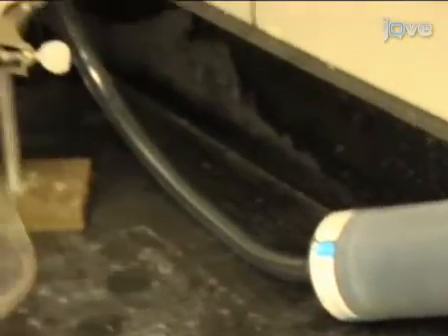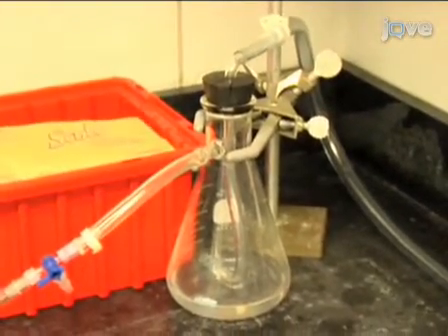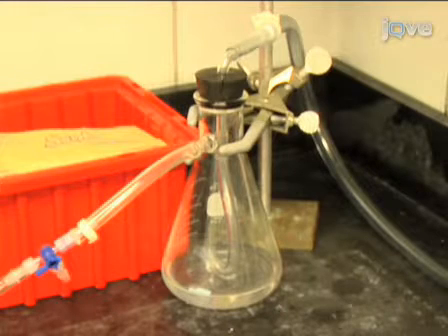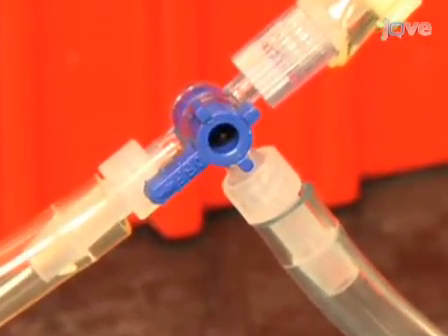Rubber tubing connects the air source to a carbon filter for air filtration. Rubber tubing also connects the other side of the carbon filter to an Erlenmeyer flask via a hollow rubber stopper. The flask should be filled with about a ½ inch of water, which will humidify the air. The flask should also have a small sidearm, which should be connected to a Y-shaped valve via more rubber tubing.